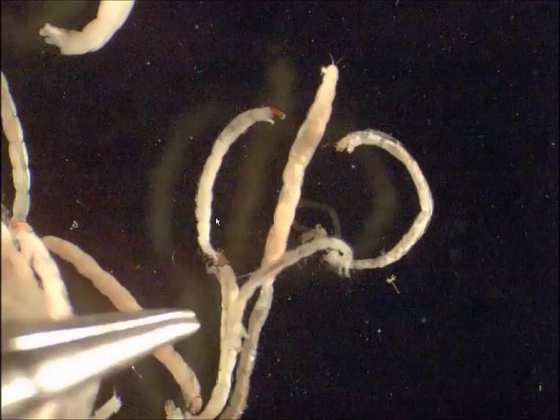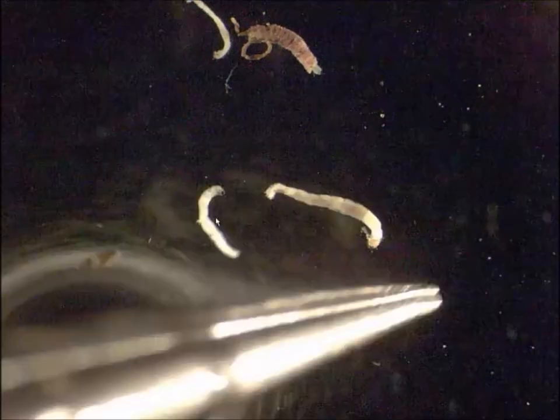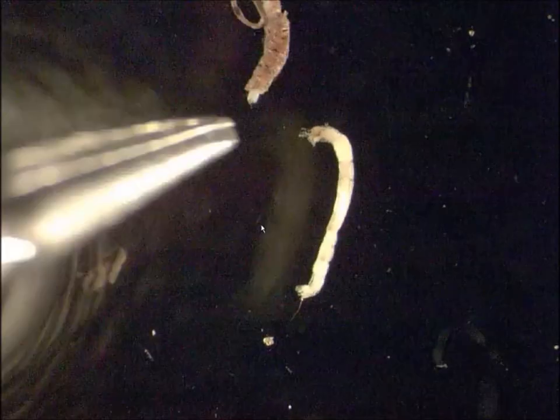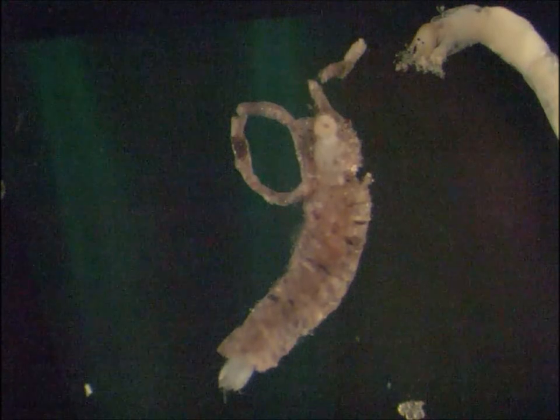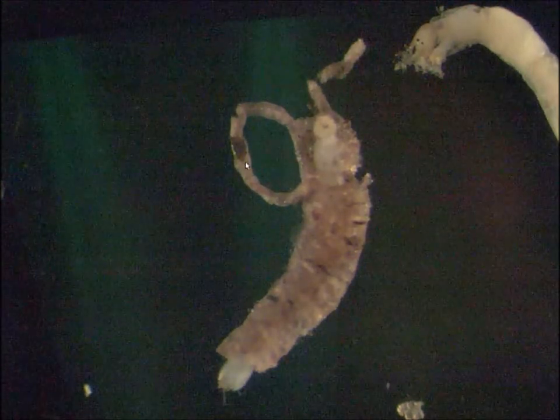You're going to have varying rates of maturity among specimens, which is really a pain with Tanytarsini if you're taking them past tribe level. Here are a couple more Tanytarsini. I wanted to show you Rheotanytarsus in its case — the tendrils on the case are actually diagnostic for that genus.